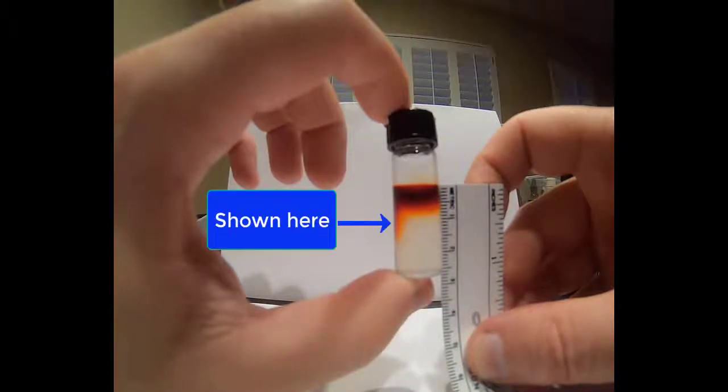And then I finally measured the diffusion of Congo red. Although the angle of the camera is a bit awkward here, the result is about 5 millimeters, which you should record. Also note that there is some dye that has leaked between the agar and the glass of the vial. This sometimes happens due to the expansion and contraction of the agar within the vial and can therefore be ignored as a known experimental anomaly.